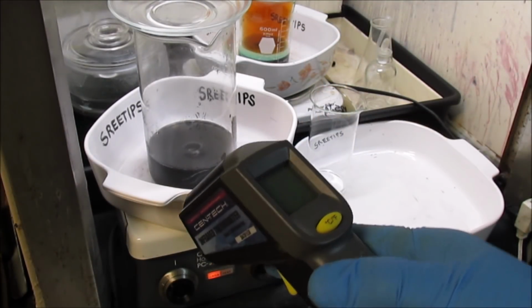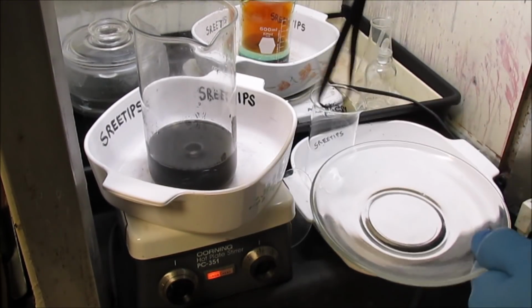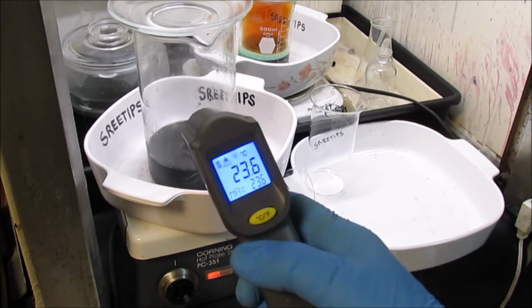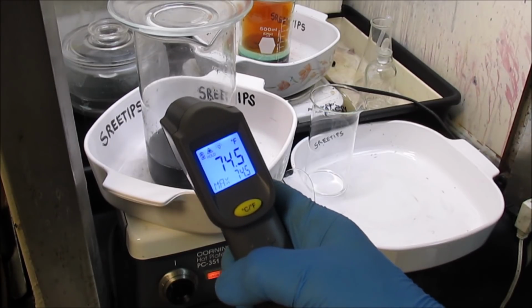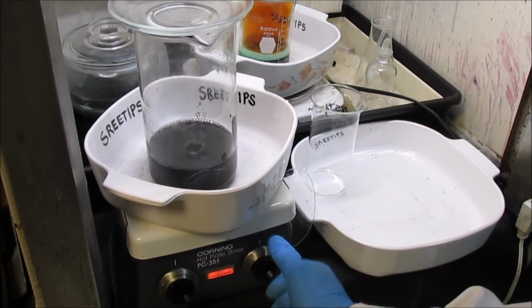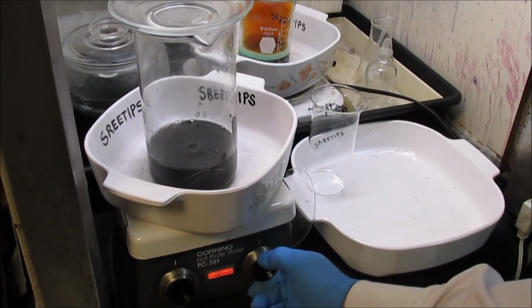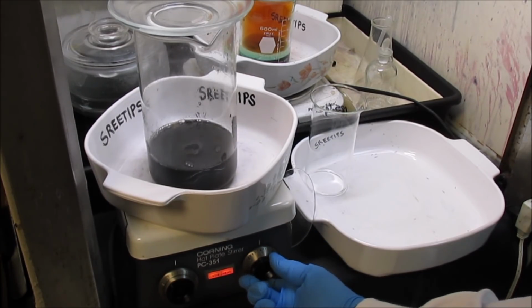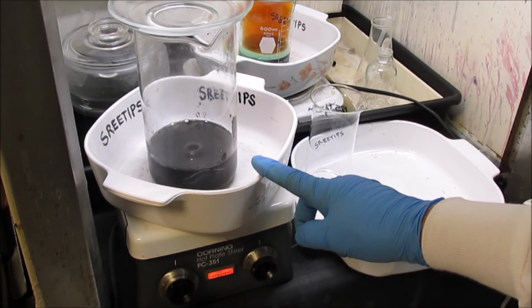I'm going to reach in there and get a temperature reading now so we've got a baseline. It looks like we got 23.6 Celsius, 74.5 Fahrenheit. I'm going to turn the heat on here to about medium high. This scale goes up to 7, so I'm putting it on 4. See if we can get this stuff to boil, get some of the copper out of there.